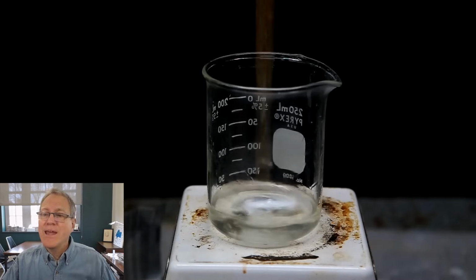That is not lidocaine. Now, these personal products, they can have all kinds of stuff in there. There's xanthan gum. There's potassium sorbate in this according to the ingredient list. I don't know what that is, but it's something that was already in that mixture. So as it turns out, that something was also insoluble in water, so it precipitated with the lidocaine, and now he's able to remove it because whatever that impurity is, it's not soluble in ethanol, so now he can get rid of it.